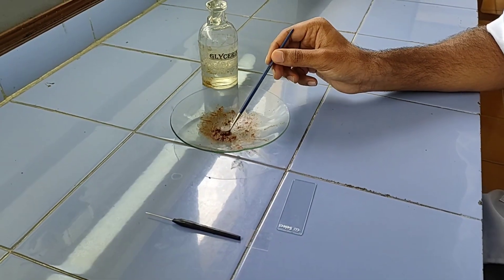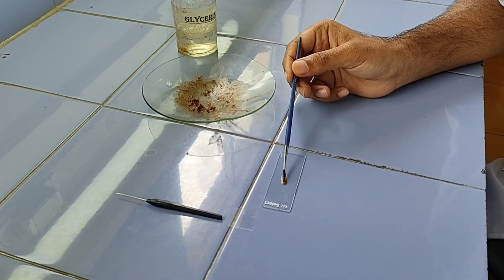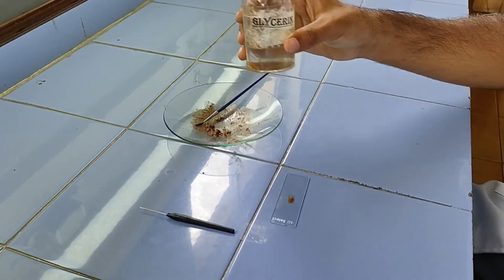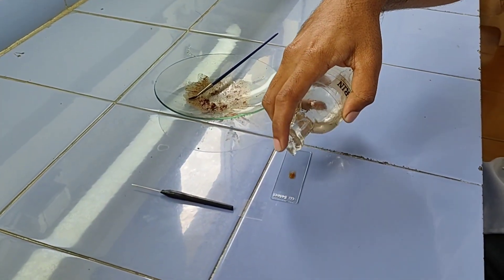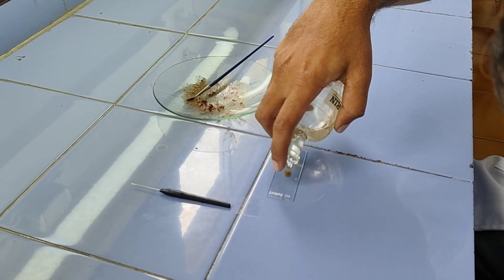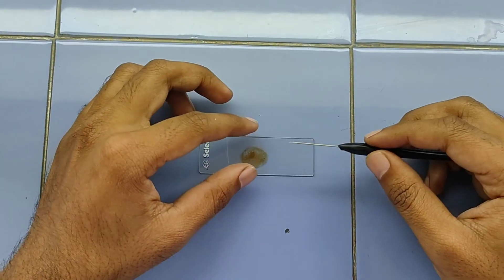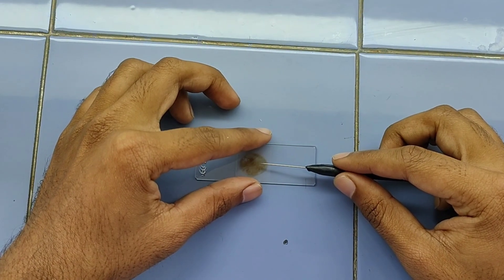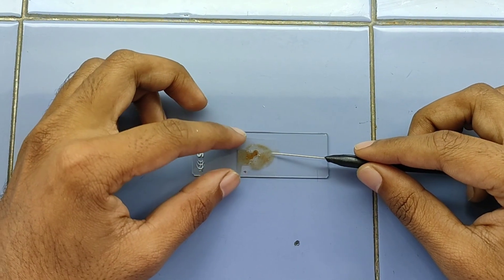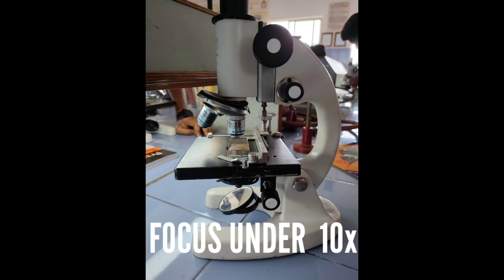After preparing the sample, carefully mount it on a plain slide and add a drop of glycerin. With the help of the needle, place the cover slip and observe that there are no air bubbles. Now observe under 10x microscope.